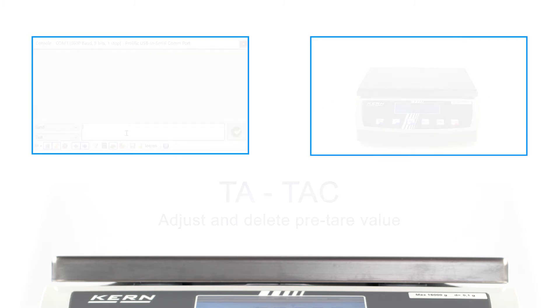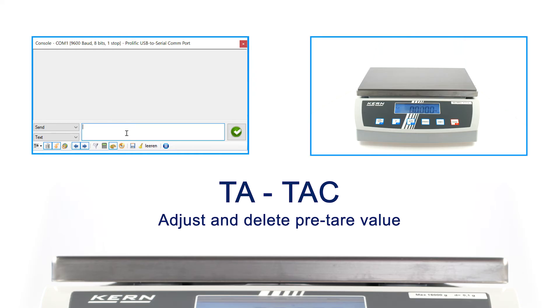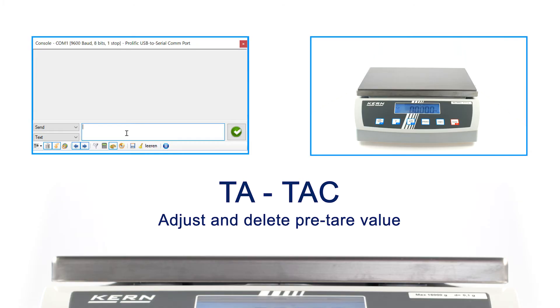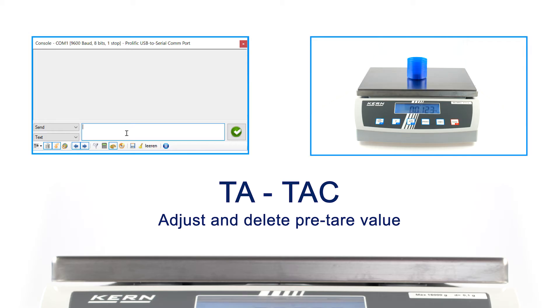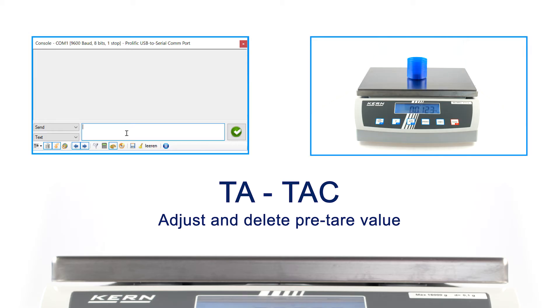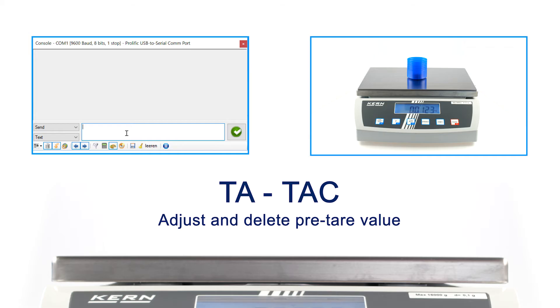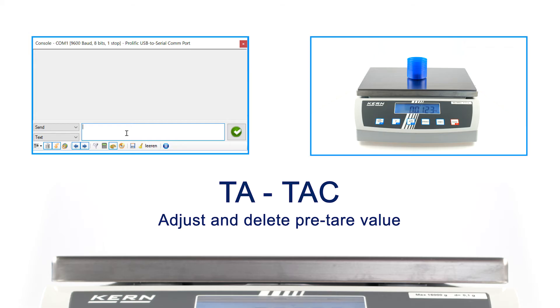A pre-tare of the scale can be done with the command TA. For example, containers can be tared before the measurement. Enter the desired tare value by sending TA followed by the value of the container, and wait for the balance to respond.